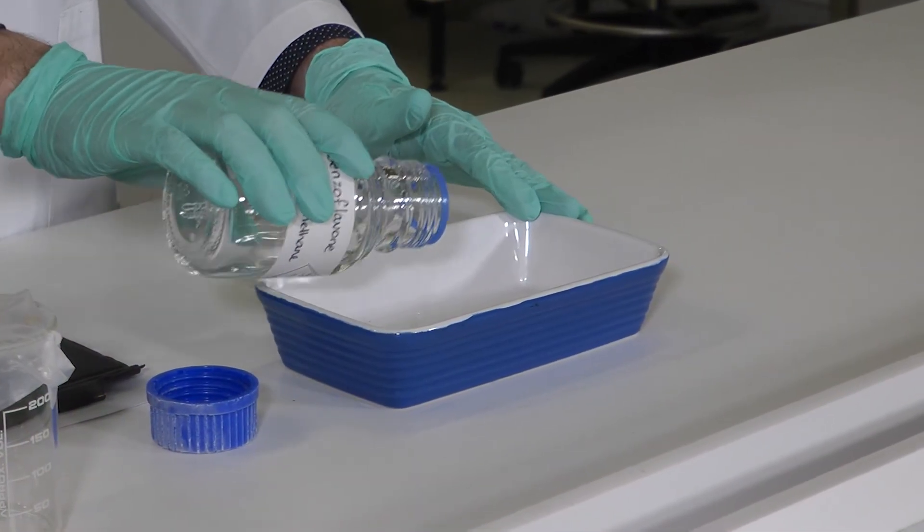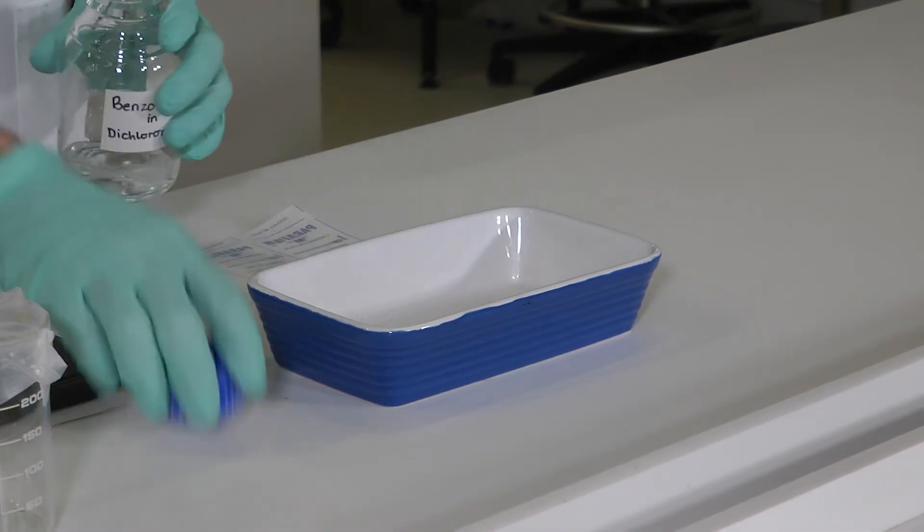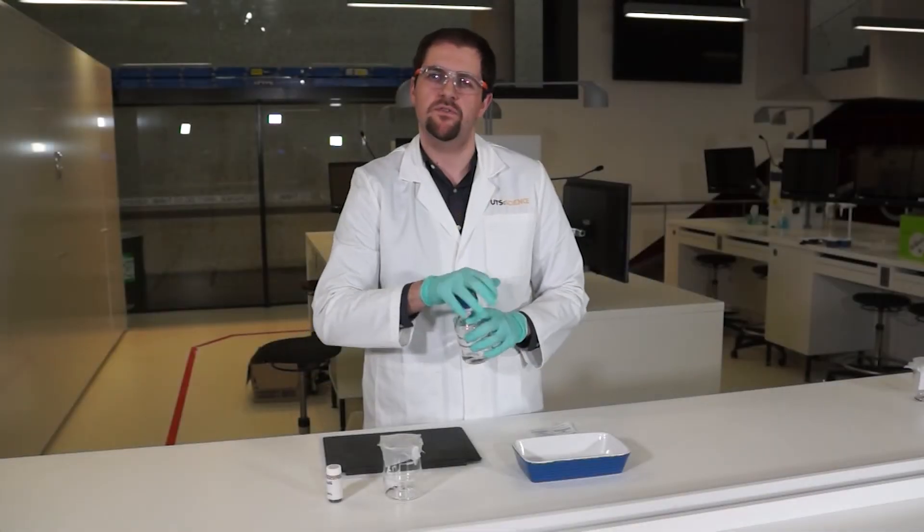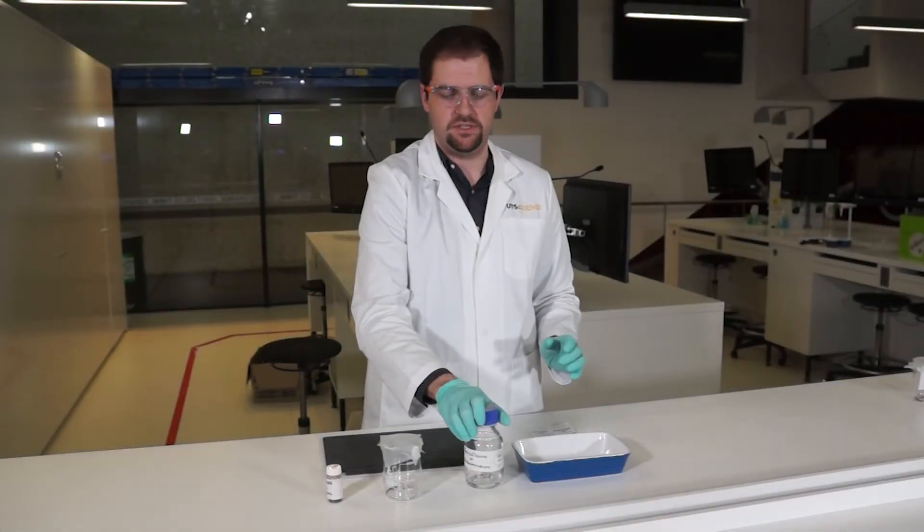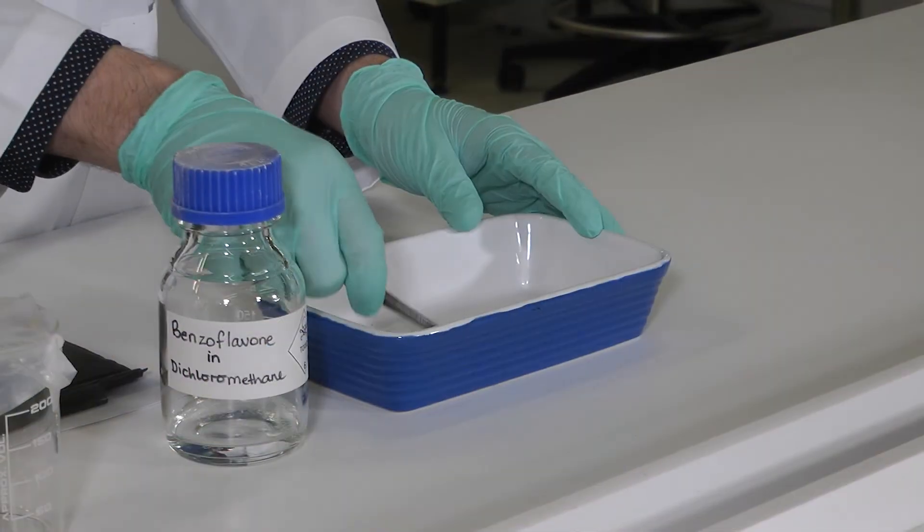We're going to just leave that submerged in there for a couple of seconds, and what's going to happen is that we're going to form some nice dark blue ridges where our iodine has developed.